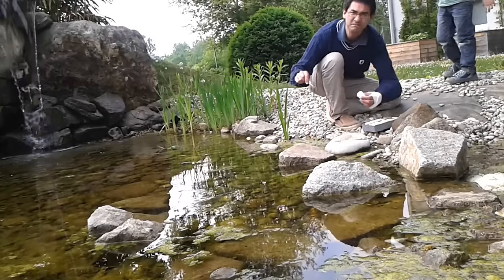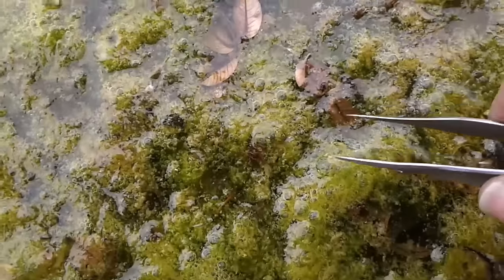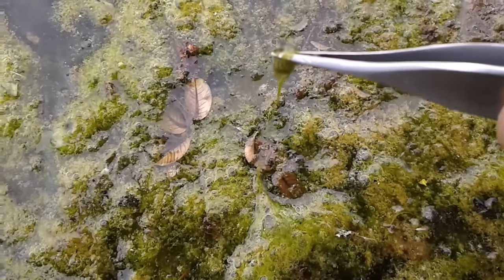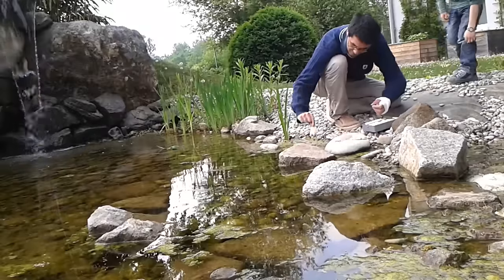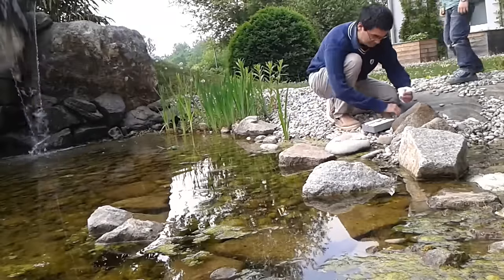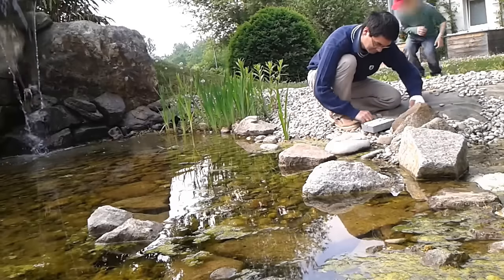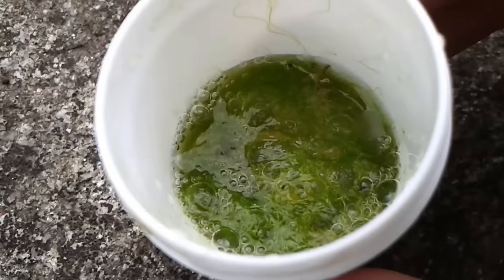I'm using my favorite tweezers. I consider them to be the most useful tool of a microscopist, and of course I want to take along a little bit of water as well. Everything is closed watertight and then taken back home to my lab.